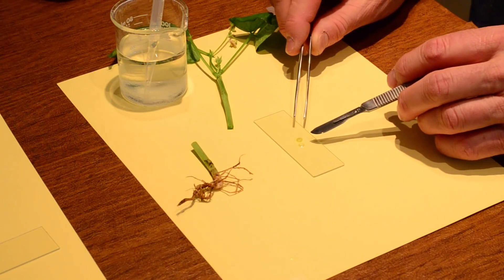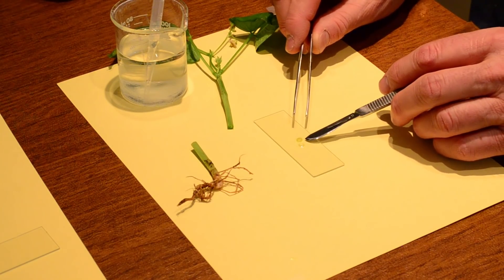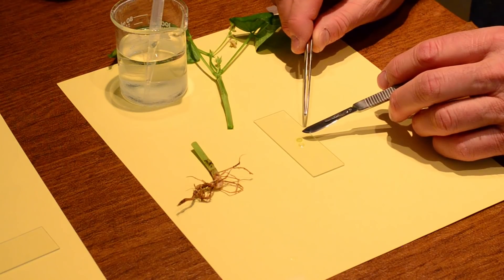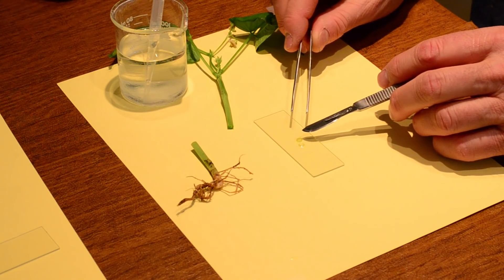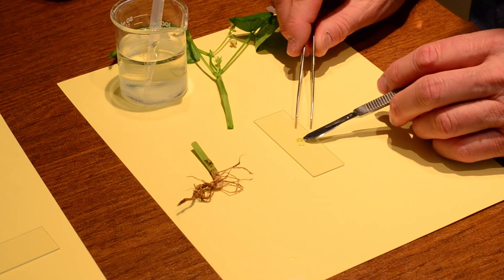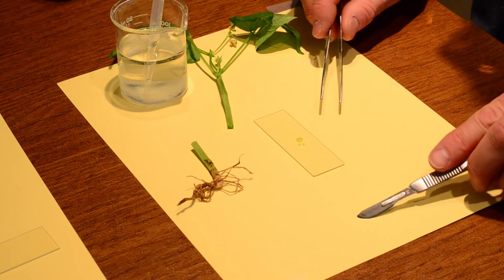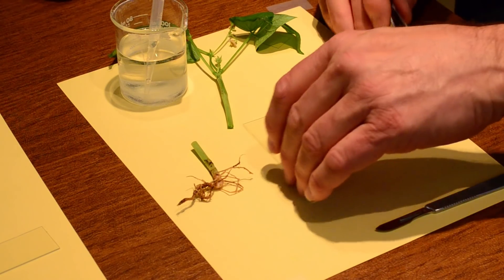And that is kind of like a cardiovascular system in a way. Because we're moving fluids around in vessels. And so plants do the same thing through tubes that we call xylem and phloem. I'm going to do another one. This is too fun to stop now.